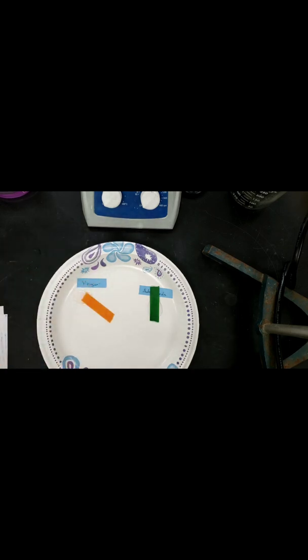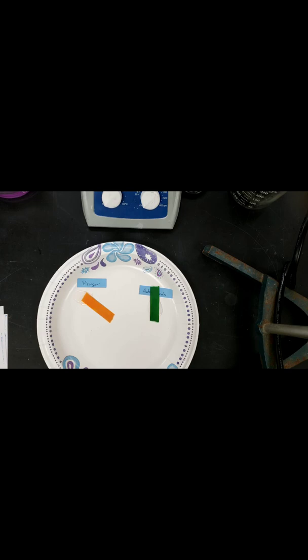Once your cabbage juice has cooled, we are going to clean this plate up. We are going to start with some new substances that have not, or the same substances, but that haven't been tested and we are going to test it with the cabbage. Make sure that you take a picture of the pH paper to include in your presentation as well or in your PowerPoint. So I have now cleaned up the pH paper. I have my vinegar added to the plate. I have my baking soda. Again, I need to add just a little bit of water because baking soda is a solid. So I am going to add a little bit of water, dissolve that baking soda.